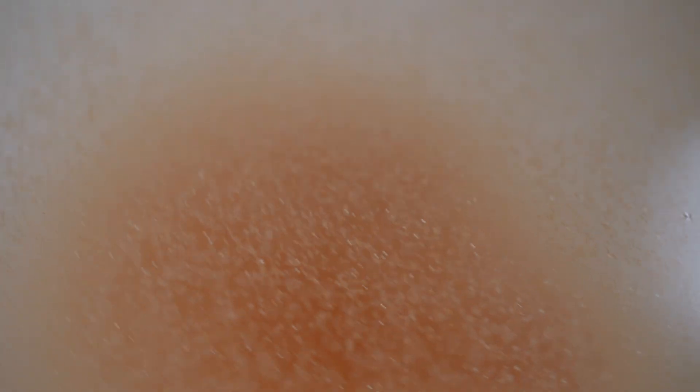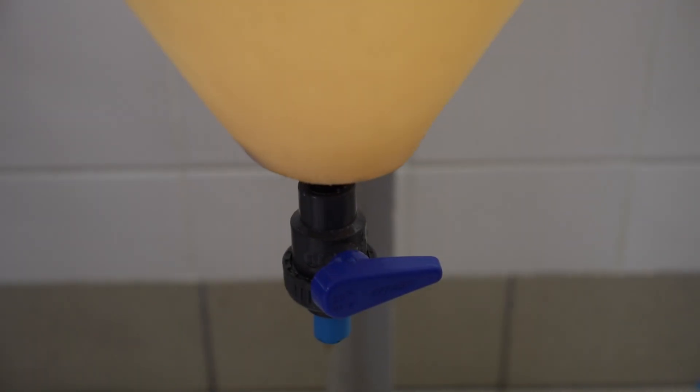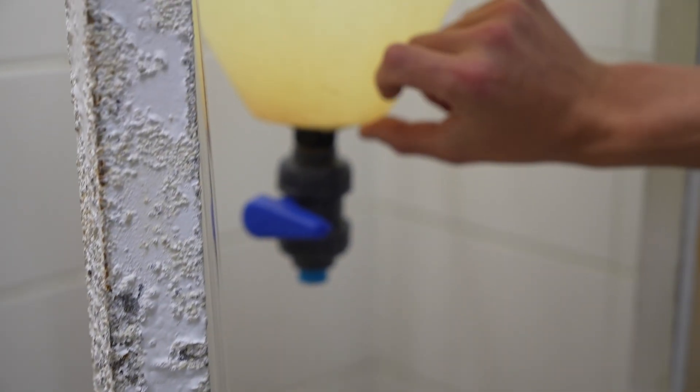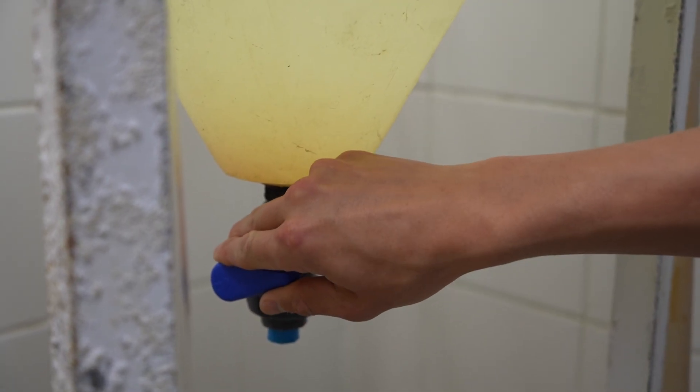These guys are ready for harvest and we're going to harvest them today to feed. You can see the artemia swimming on top and then throughout the water column. And then the unhatched ones or the dead ones, they'll be sitting on the bottom. You can see like a bit of orange at the bottom. And then when we drain it, we always drain the dregs up, that's what we call the little bit the bottom, the dead or the unhatched.